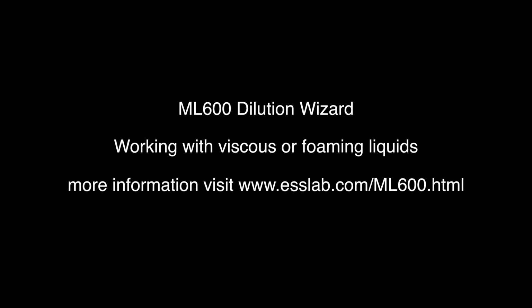250, yeah. So we'll look at that process that we looked at previously, where we were aspirating a small amount of sample to a dilution ratio of 1 to 200. We'll repeat that, and what you'll note is the speed that the system drives actually operate at. First step, you may recall that we were aspirating our amount of diluent.